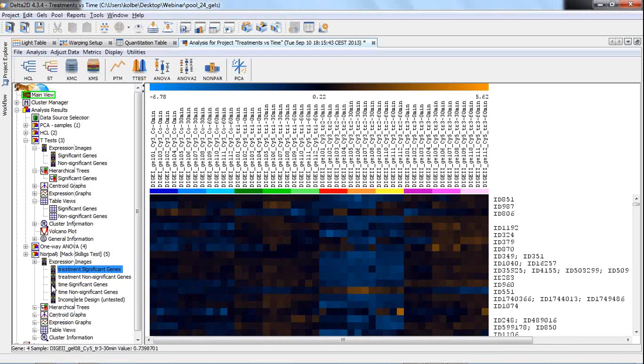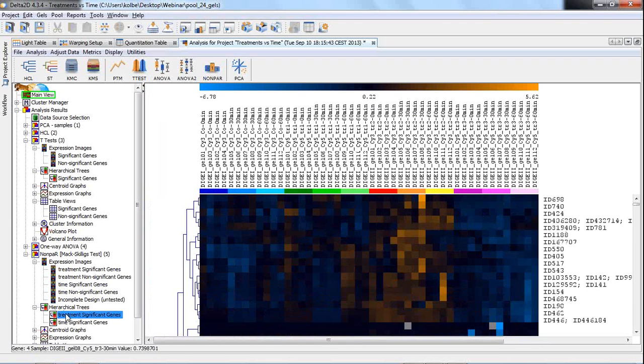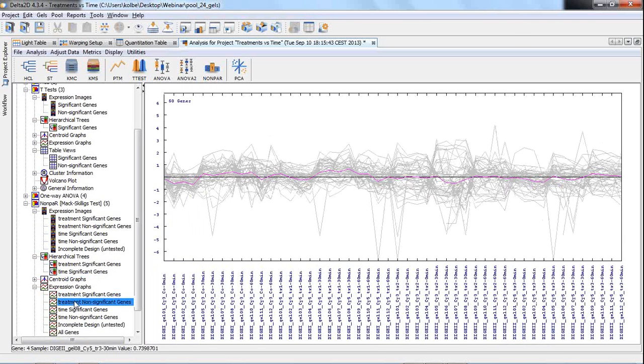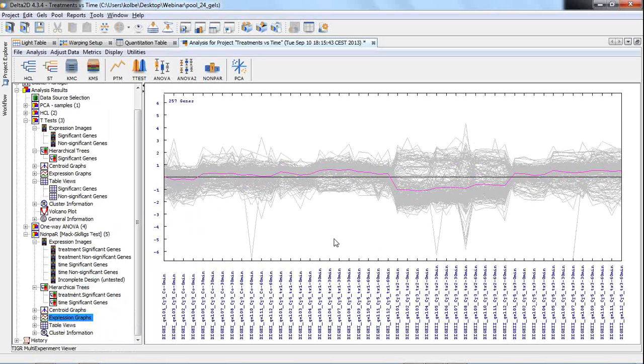We have different parts now, different views on our results. Treatment significant genes, treatment non-significant ones, time significant, and so on. So it depends upon what you want to learn, which of the views you can open, and then there are treatment significant genes and time significant genes inside, and you can then also find with some operations that you can learn about in the manual how to combine these and find those expression profiles that belong to both. You can also view that as graphs for the significant, the time significant, and so on. So a lot of different views, and it's up to you what you're interested in, where you want to focus on.